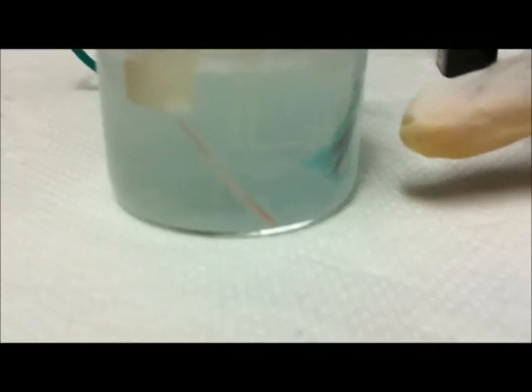Here's another close-up of the sample, a small amount of powder inside. Of course you can scale up this reaction and make more copper hydroxide and store it.